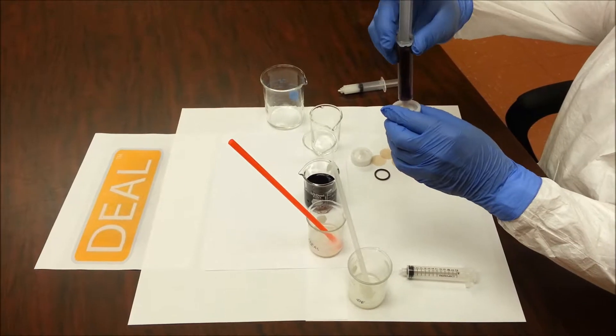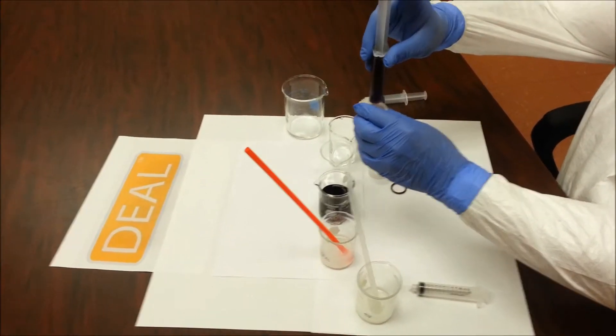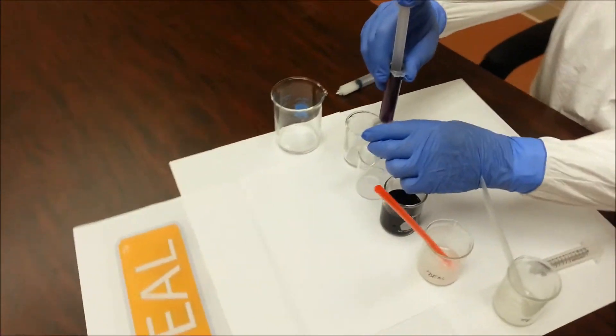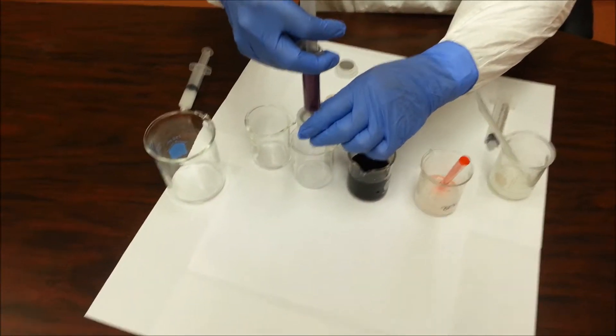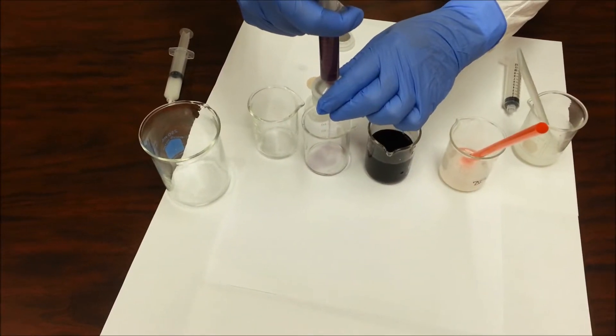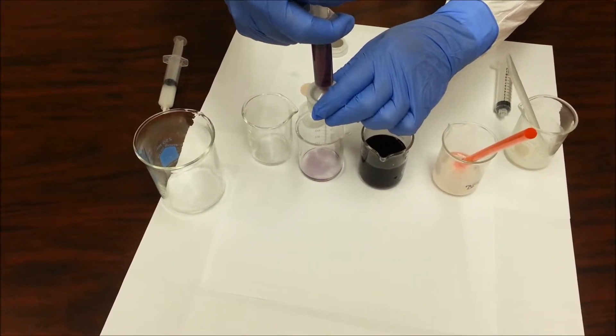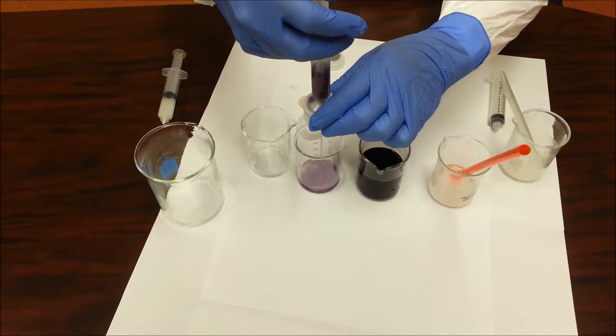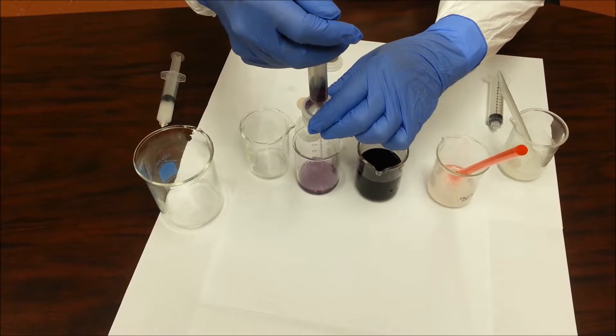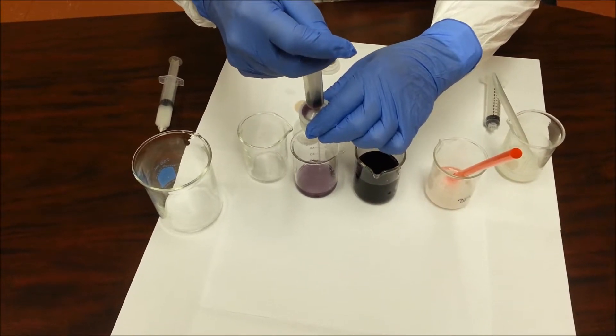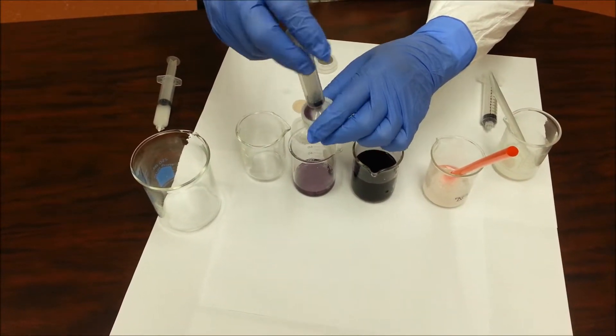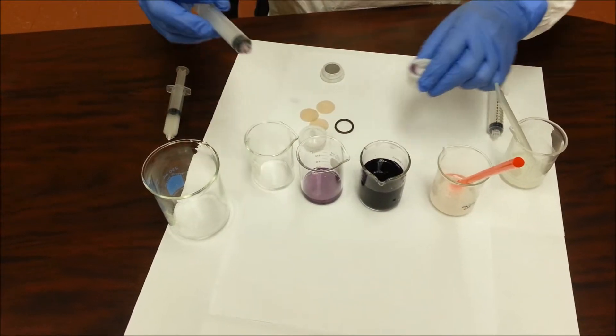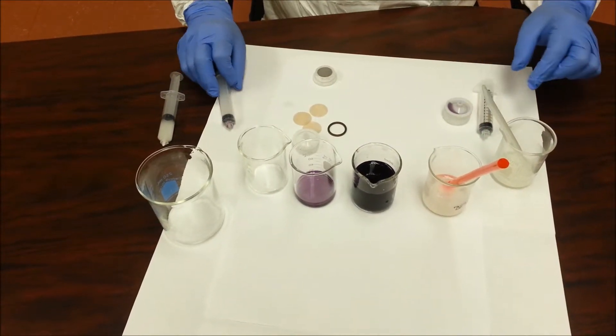Leo, what is the thickness of the pre-coat? About how many millimeters? Three millimeters. And the color is coming through, indicating that the five nanometer ink particles are not being absorbed at all by the DE alone.